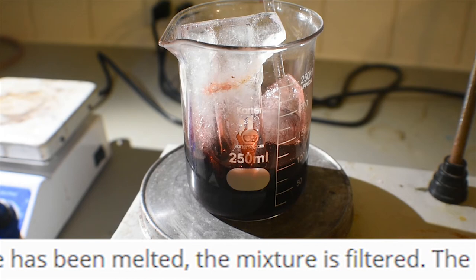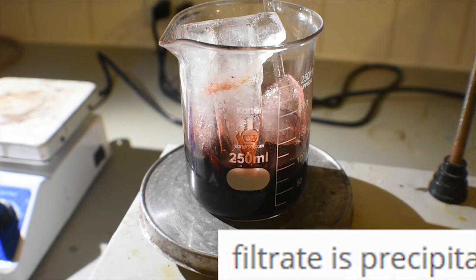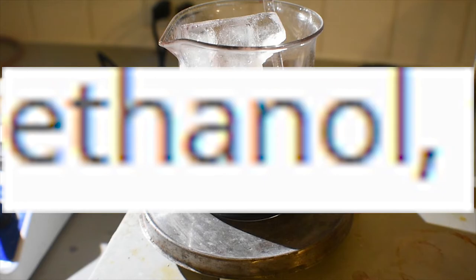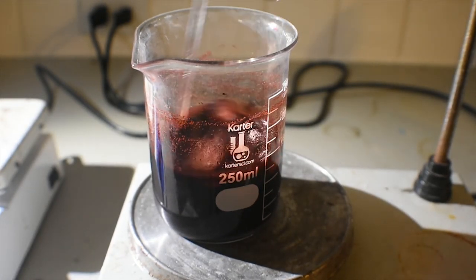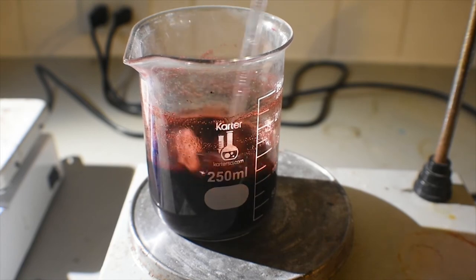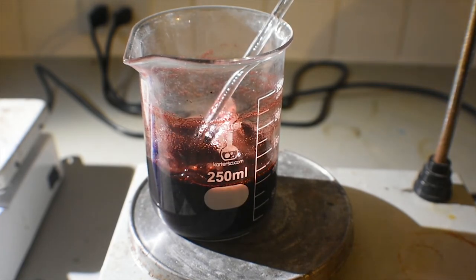Okay, I know not all the ice is melted, but I'm just gonna go ahead and filter anyway. I don't have time.